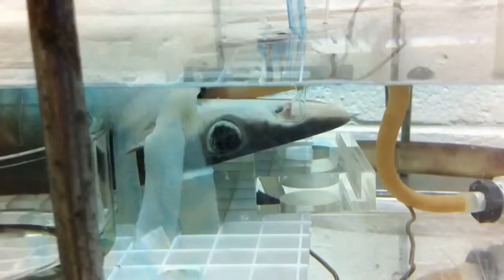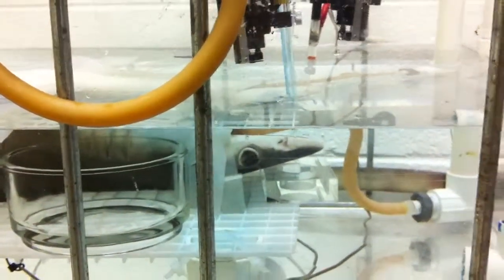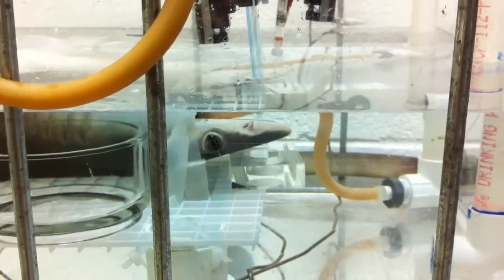hits the receptors, and if the shark can smell whatever I've put in that water, then this electrode will pick up the signal and have that response on the computer screen.